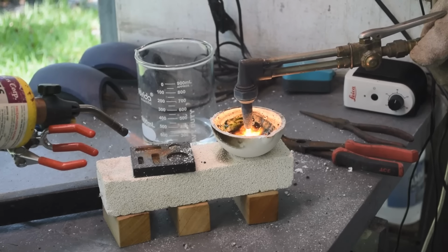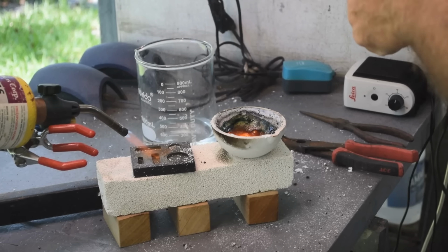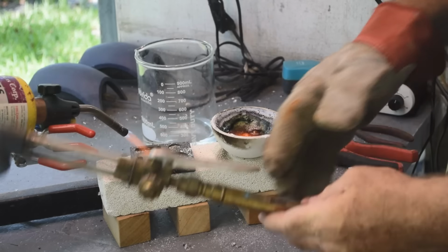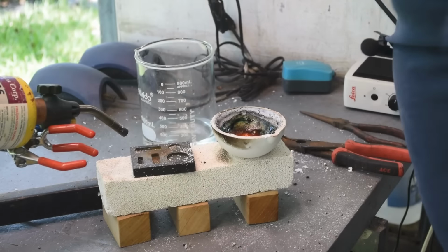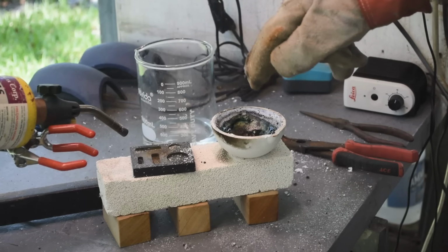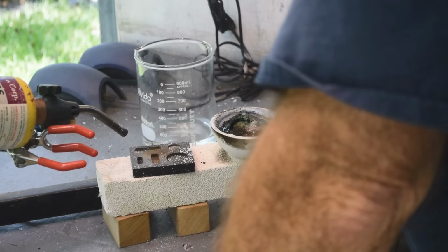It's just not working. All right, I don't seem to be getting anywhere. So I'm just wasting gas at this point in time because I can't get this crap to melt. Holy cow. Huh.